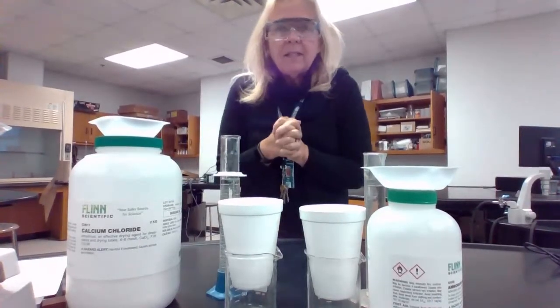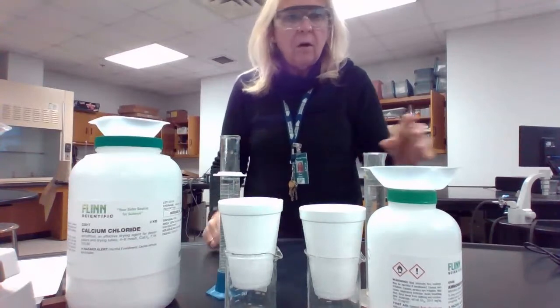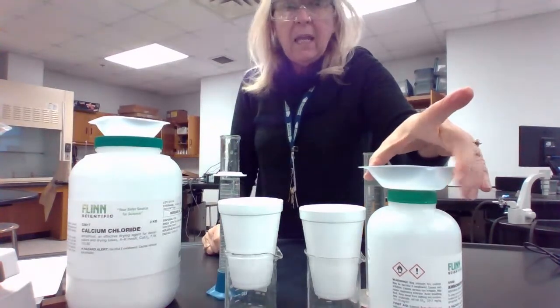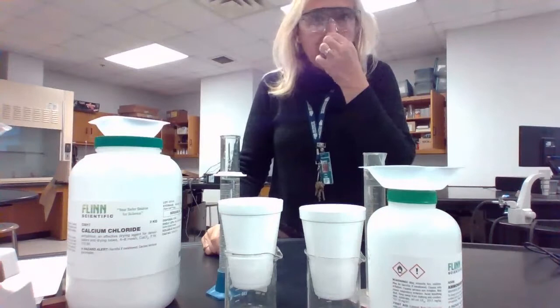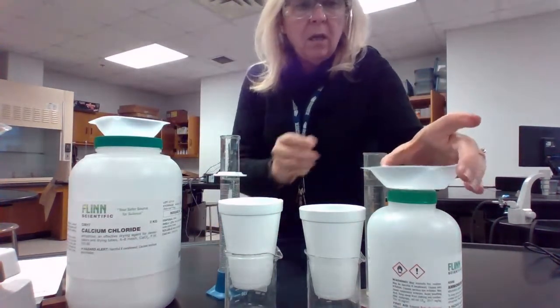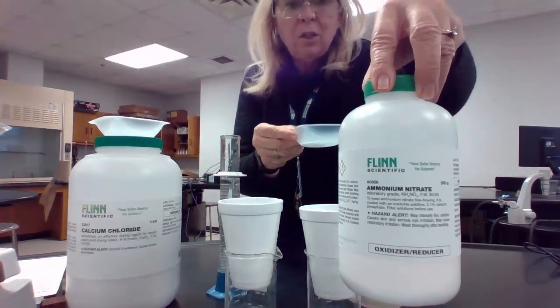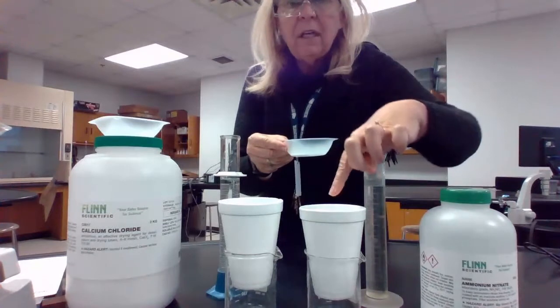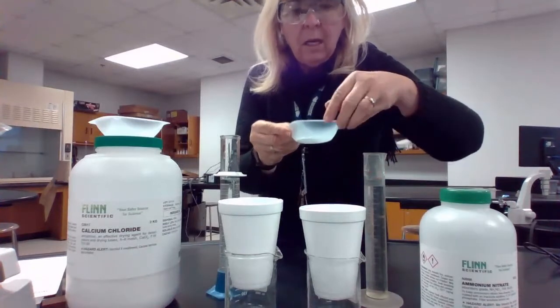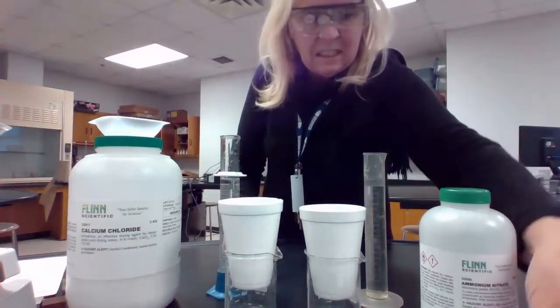Okay, hi everybody. Today we're going to start with a demonstration of some heat that is being evolved or used in a chemical reaction. In this case, our chemical reaction is going to be the dissolution of a couple of chemicals. The first chemical that we're going to dissolve is going to be ammonium nitrate, and we're going to dissolve it in 100 grams of water. And I am putting 3.3 grams of ammonium nitrate into there.